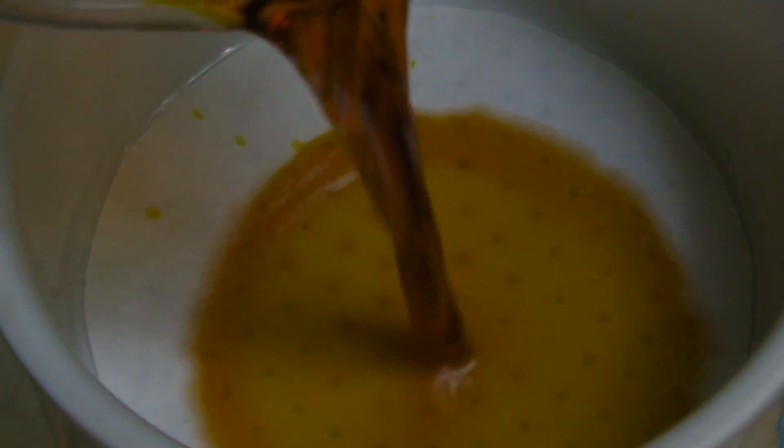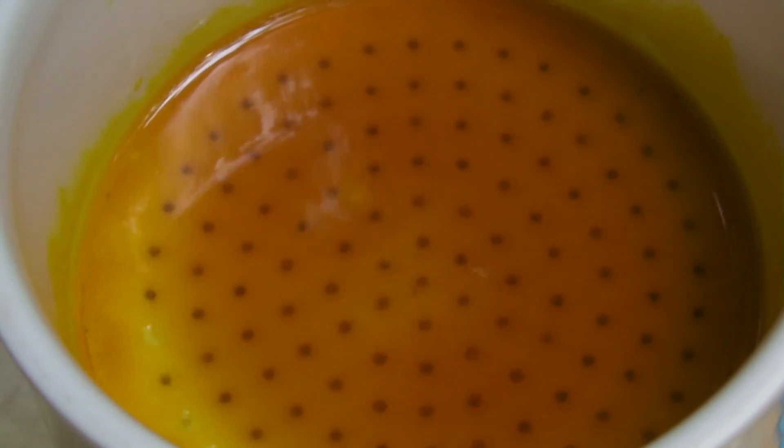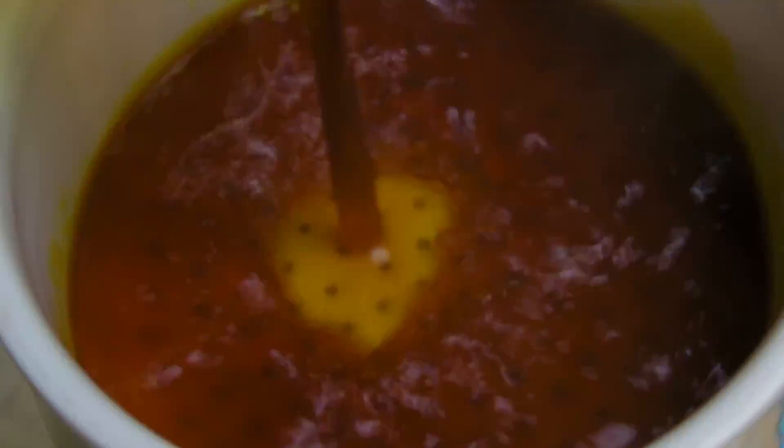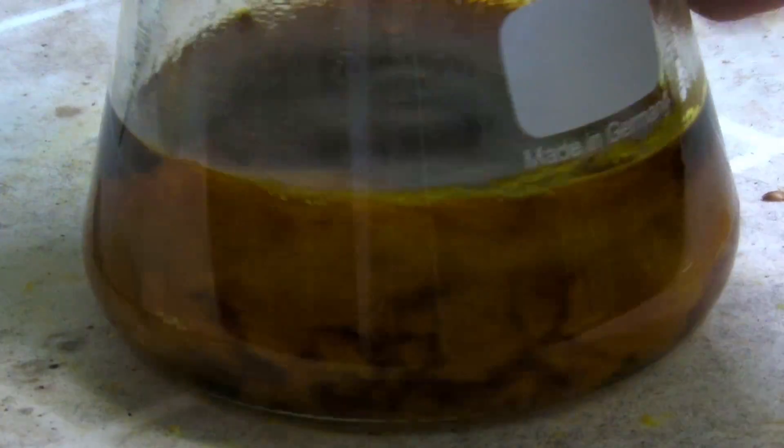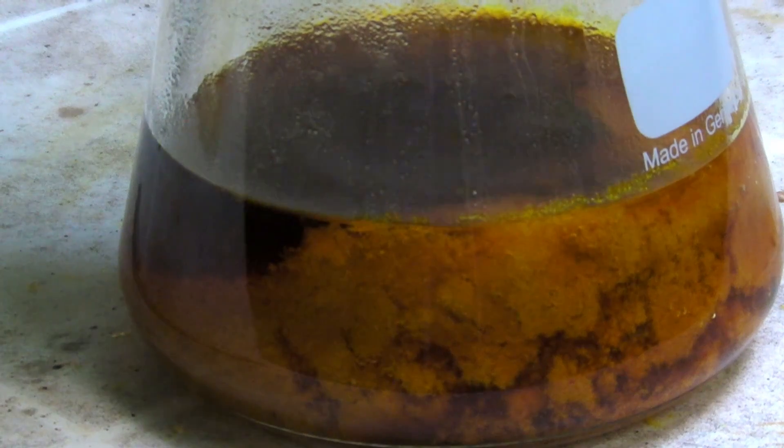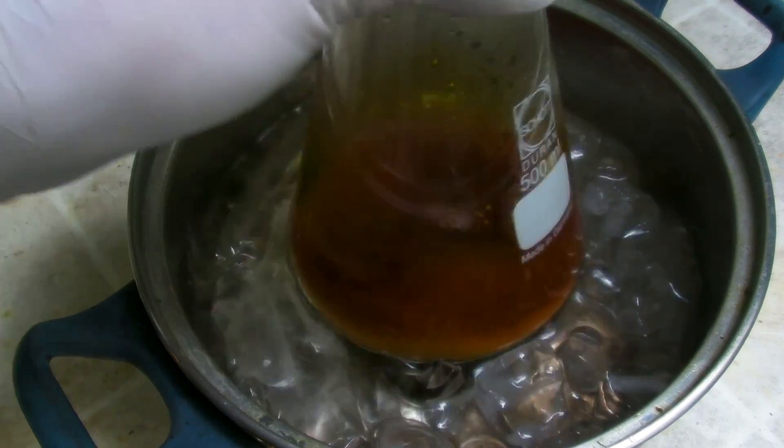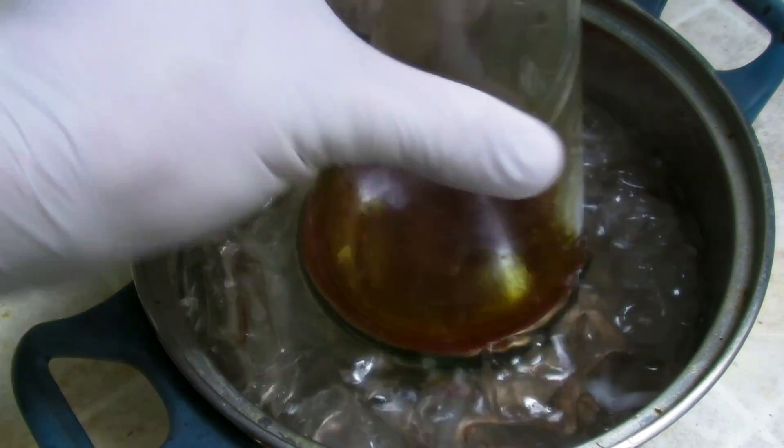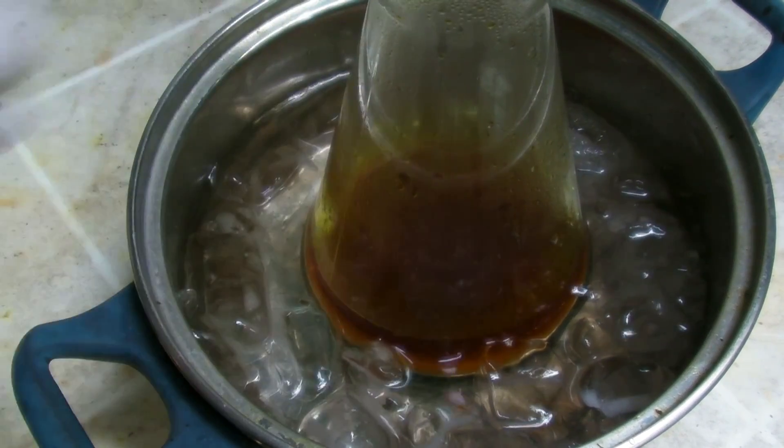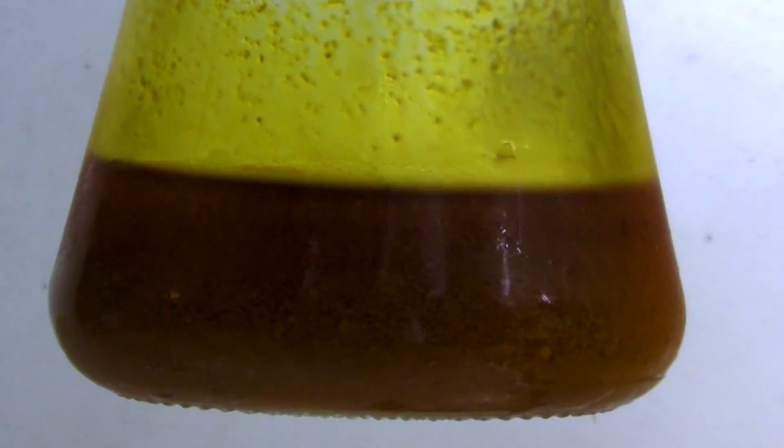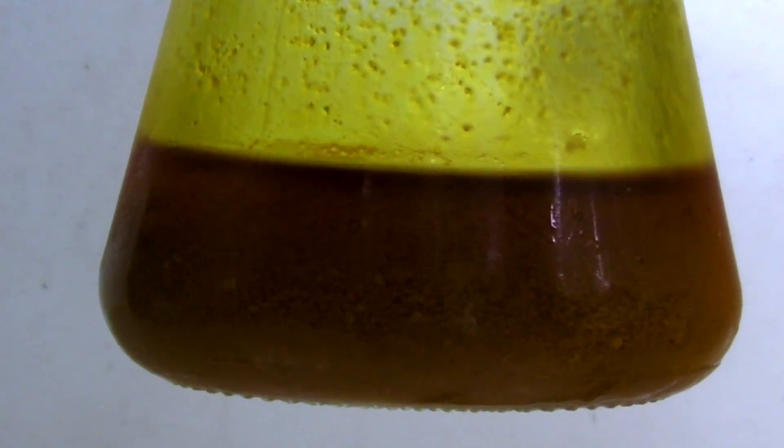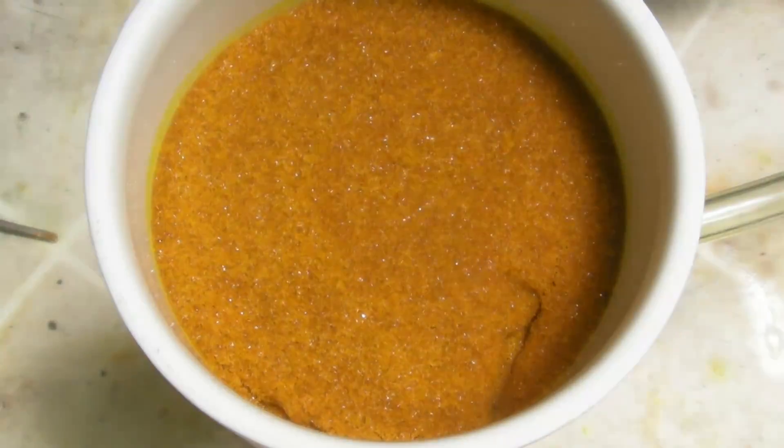What can be seen here is that the organic compounds precipitated within a few seconds in the flask. The flask was then cooled with ice. After cooling a large amount of precipitate had formed, the solution was then cooled further in a beaker. It was filtered off again and the beaker was washed with some ethanol.